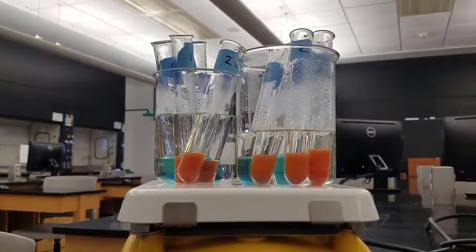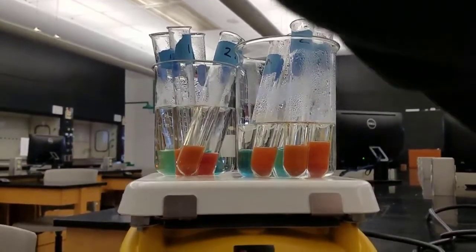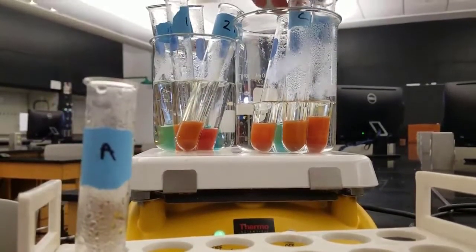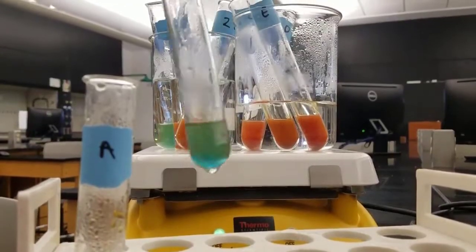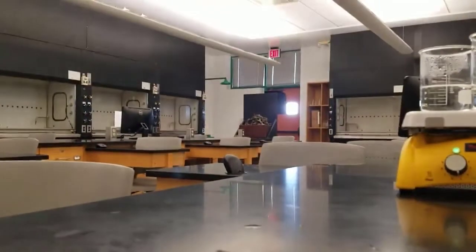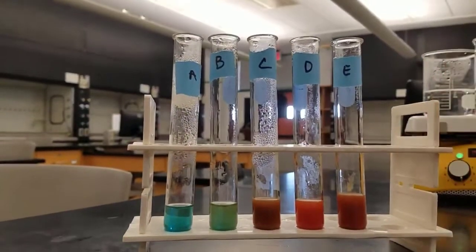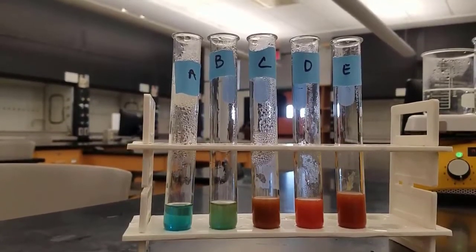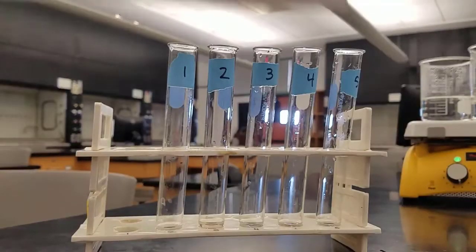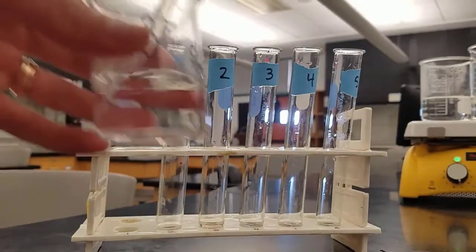On the first page of your experiment you have some test results you can compare these to — different colors and what percent of glucose they correspond to. Test tube A shows not much color. Test tube B has just a touch, which would probably not be a positive test. Looking at tubes 1 through 5 and A through E, the two on the left are not positive. B might indicate just a very slight amount of reducing sugar.